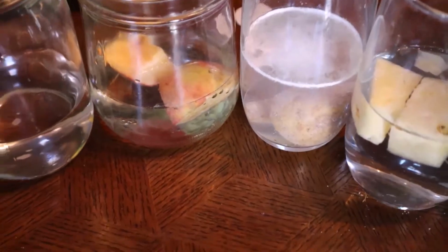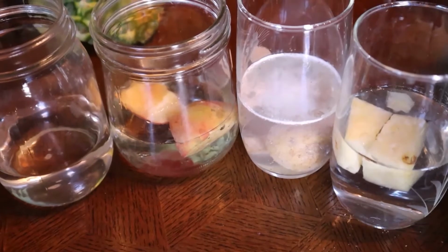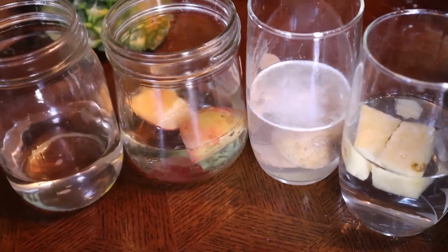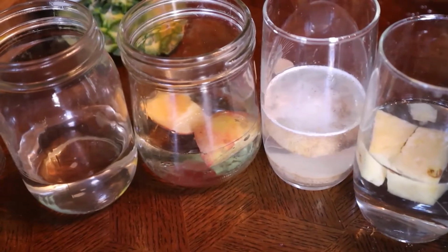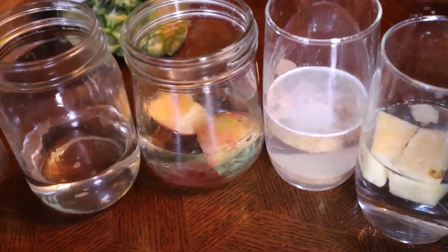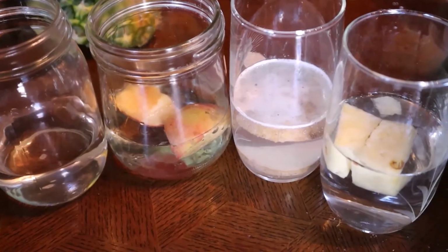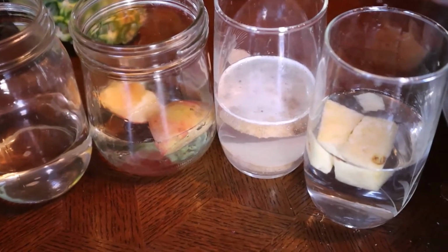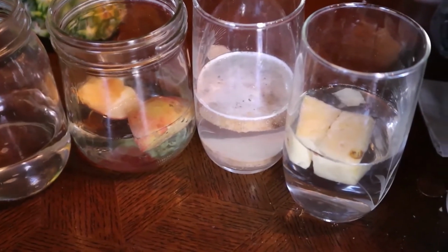Now that they have observed the reaction of all the groups and logged their observations, the students remove the pieces from the liquid. They will dump the liquid out. The reason they are dumping the liquid out is because we are going to need new hydrogen peroxide in our glasses. Again, the bubbles in our glasses and the activity that we observed showed us the breakdown occurring. So our hydrogen peroxide is a lot weaker now.